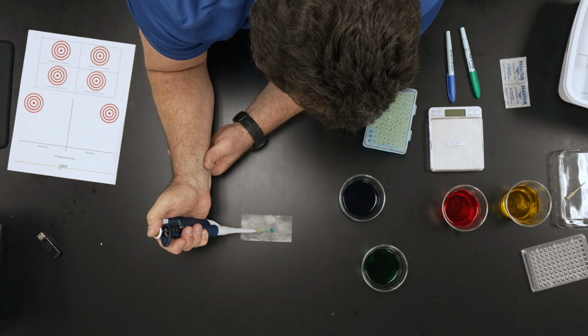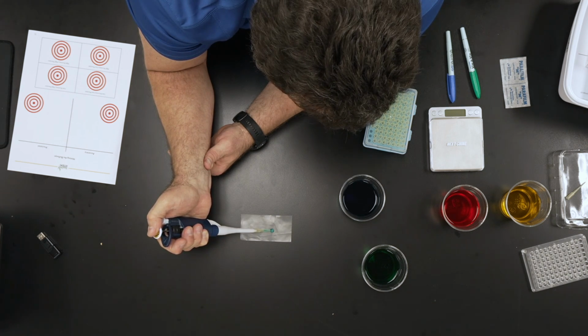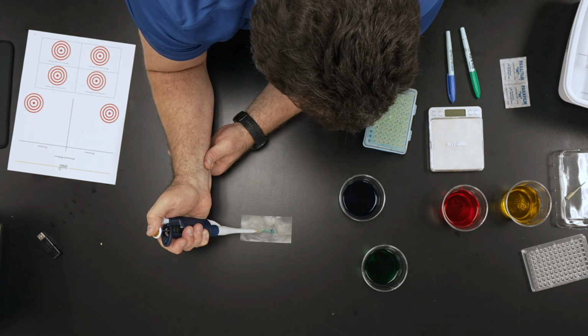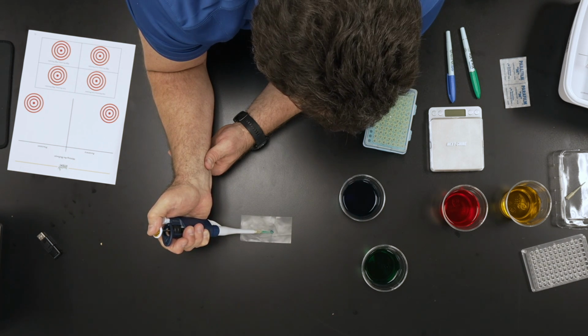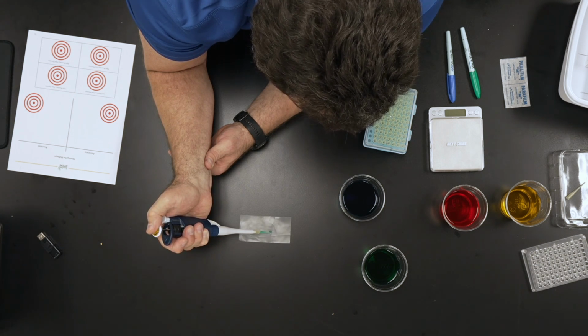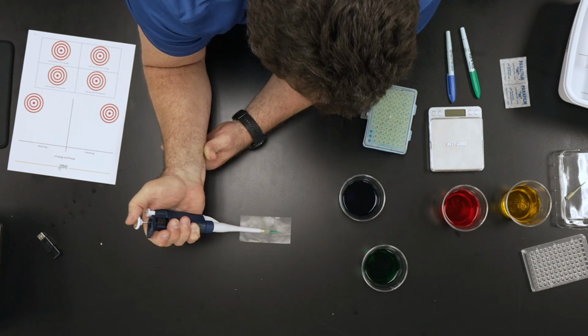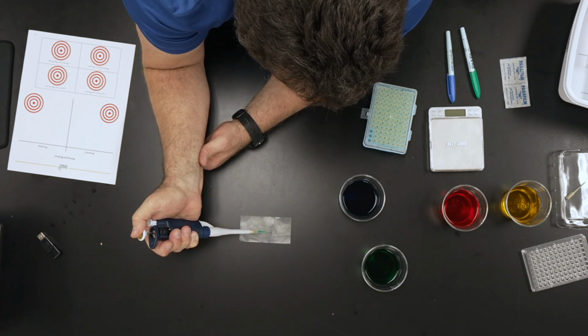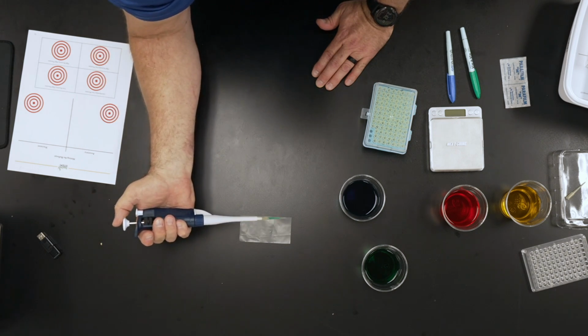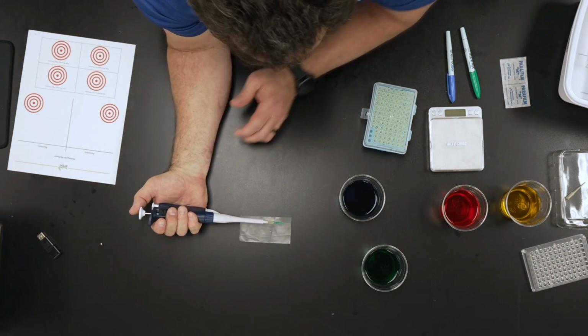And to do that, it takes some steady hands, and you also have to be able to use the tip of the pipette in the liquid in very small quantities, in fact. So as I get to this, you'll notice that towards the end, it gets a little harder to keep just the liquid in there. At that point, we should have a pipette that's full, okay? So it was much better than the first one. Is it perfect? I don't know if I'd say it's perfect, okay?